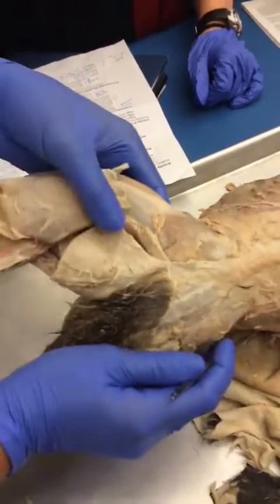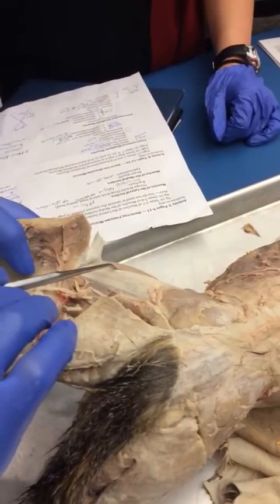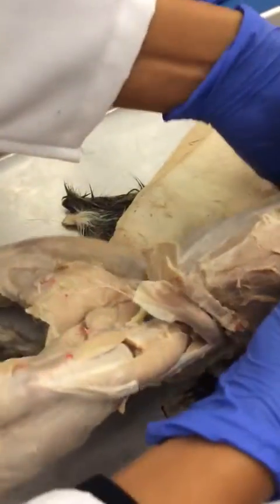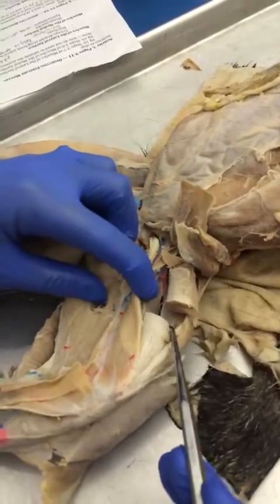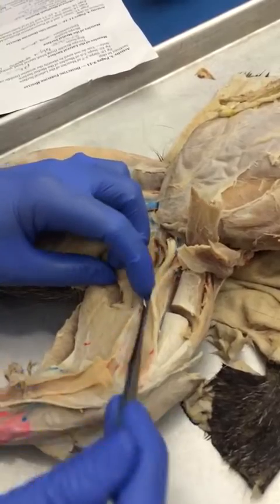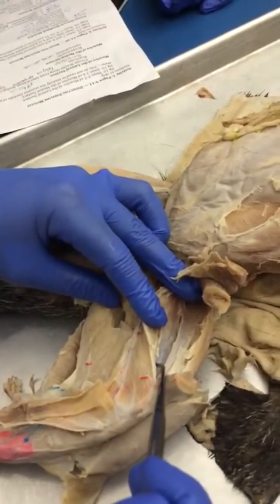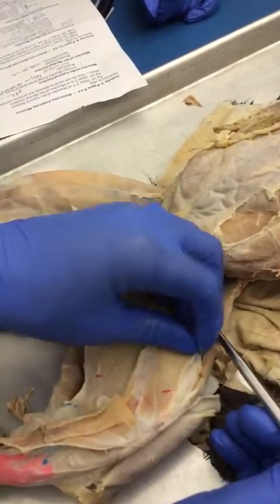Underneath the tensor fascia lata, you have the biggest of your quad muscles. And this is the lateral, vastus lateralis. That's underneath here, and you can see that extend over to this side. It cups this big band of muscle here, which is rectus femoris. Those are two of your quad muscles, and then what's this one? Vastus medialis. And then underneath all of this, you have a very small muscle up against the bone, vastus intermedius.